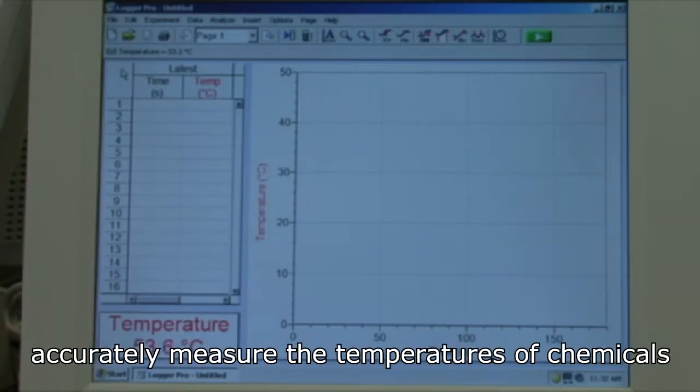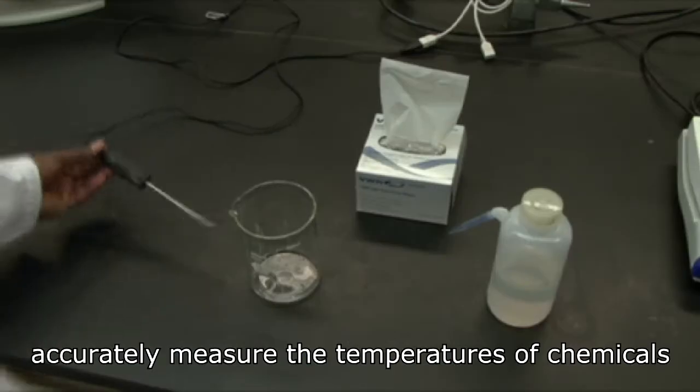Temperature probes are used to quickly and accurately measure the temperatures of chemicals in the lab.